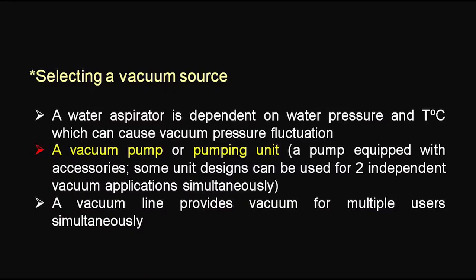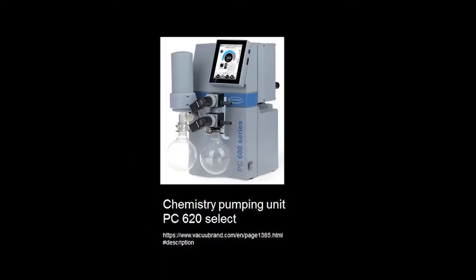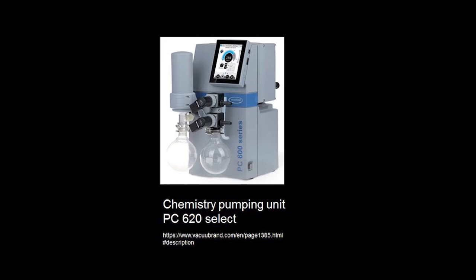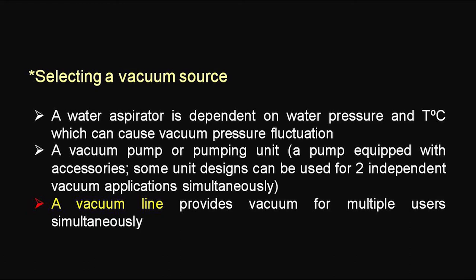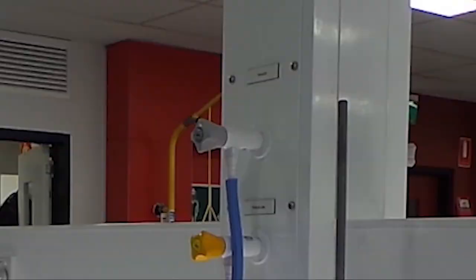Second, there are chemical-resistant pumps and pumping units. Pumping units typically include accessories such as a vacuum controller. One pumping unit can be used for two independent vacuum applications simultaneously. The third source is a vacuum line, considered to be the most efficient because one vacuum line provides vacuum for multiple uses simultaneously.